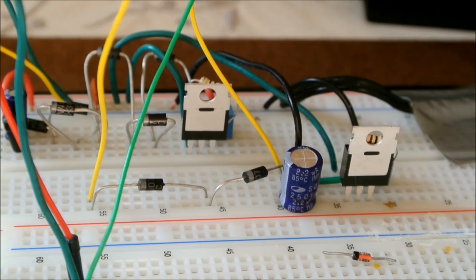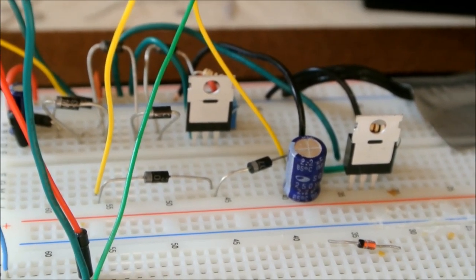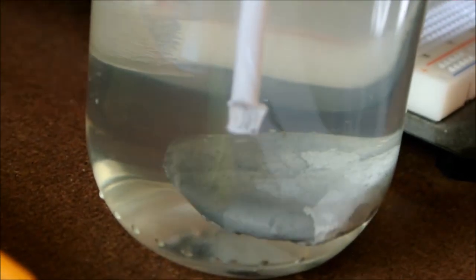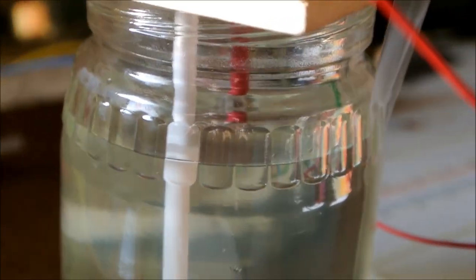Here is my second try at the experiment. And now I have two LM317 circuits because I am powering this small DC motor, which is connected to the small plastic tube out of a pen, and I just flattened the end, and that is acting as a very low RPM stir bar.